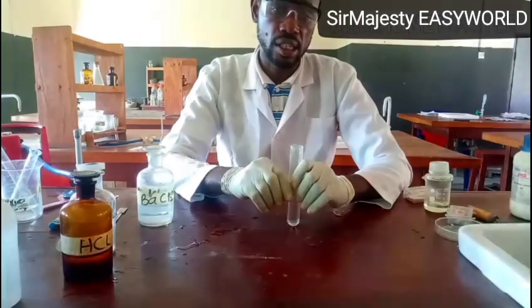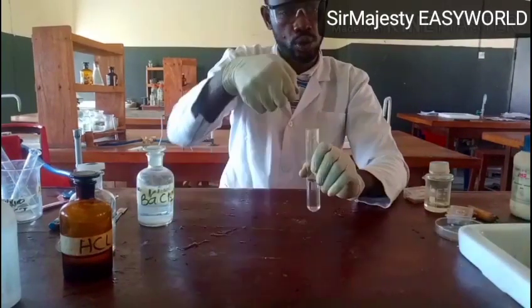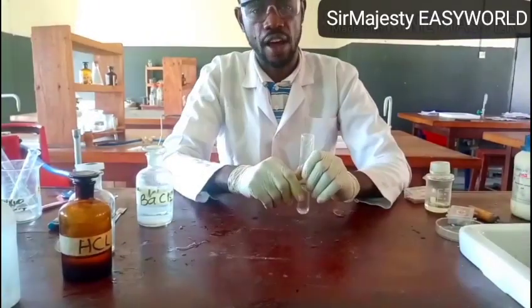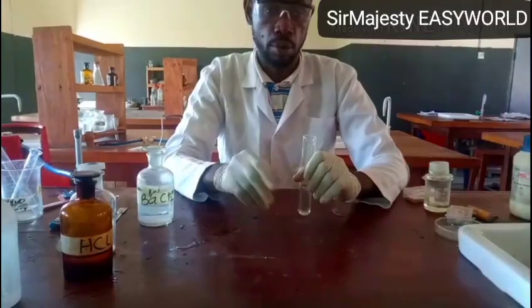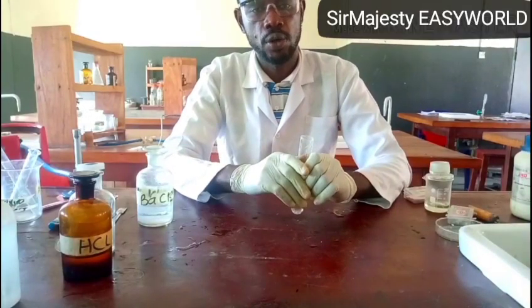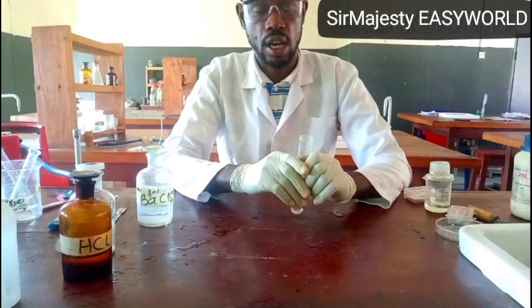Don't say that sample C is alkaline, and remember you are not told to touch it. They say just hold it close. So on holding it close, it affected the color of moist red litmus, and anything that changes red litmus to blue is alkaline, and it's obvious that the common alkaline gas we have is ammonia.